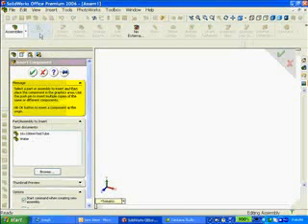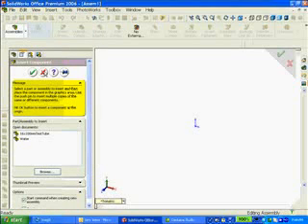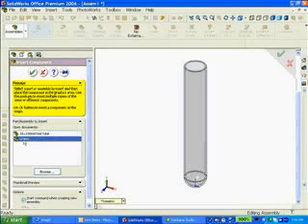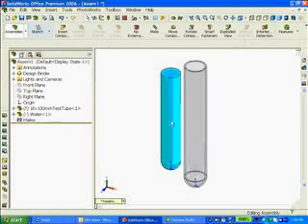The first thing I want to do is view my origins, so I know where in space I'm going to put my test tube. The origin represents the intersection of three planes, top, front, and right. Also, I see an X, Y, and Z axis. I'm going to select on the test tube and put it right at the origin. Next, I'll use Insert Component, click on my water, and insert the water into the test tube.